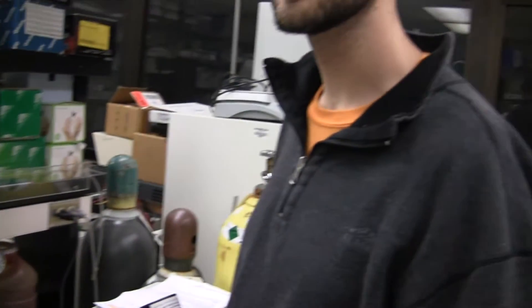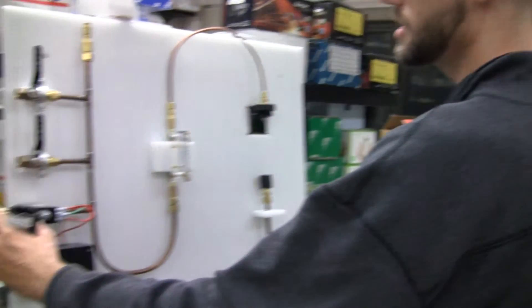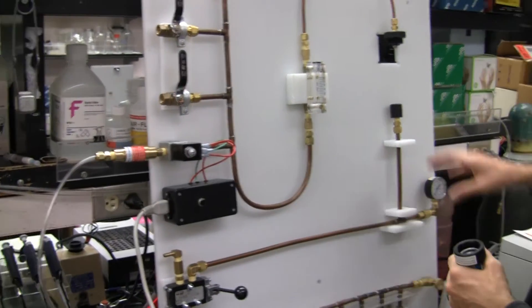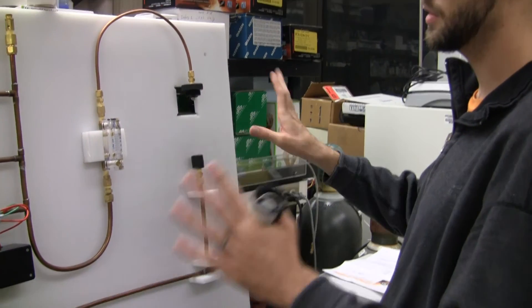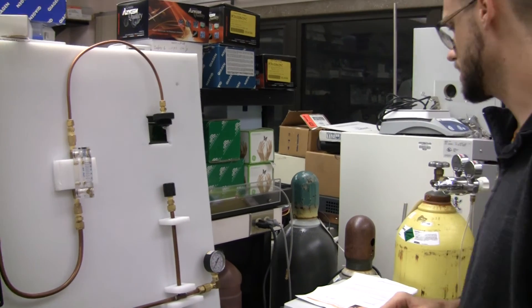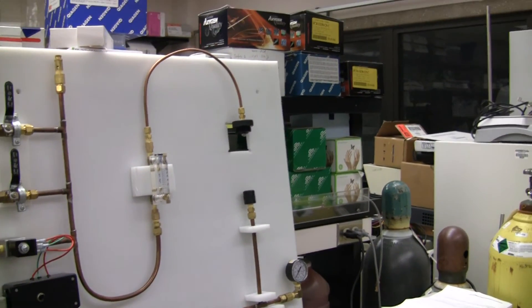Anything else I forgot to cover? I think everything is clear. So just two main things: the flashback arrestor and the oxysorb. You're just going to have to do that yourself. Basically everything else is done for you.